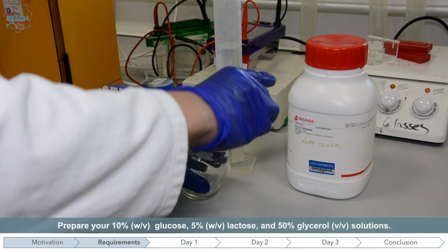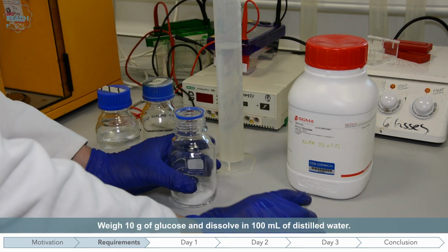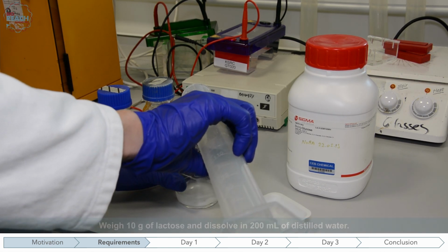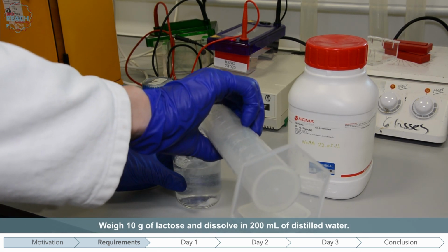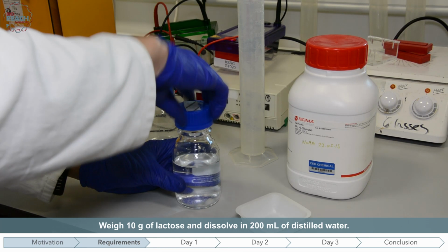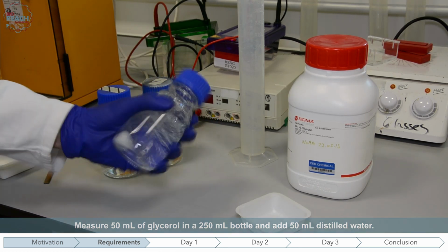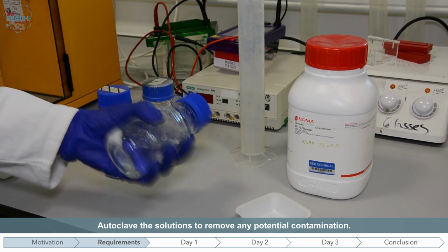We also need to prepare 3 additional solutions, each in 250 ml glass bottles. Shown here, we are dissolving 10 grams of glucose in 100 ml of distilled water to prepare a 10% glucose solution. Using the same methodology and in a separate bottle, you should also dissolve 10 grams of lactose in 200 ml of distilled water to prepare a 5% lactose solution. The third solution is prepared by adding and mixing 50 ml of glycerol with 50 ml of distilled water. All 3 solutions should be autoclaved to avoid contamination.